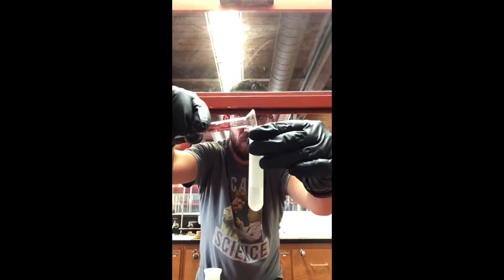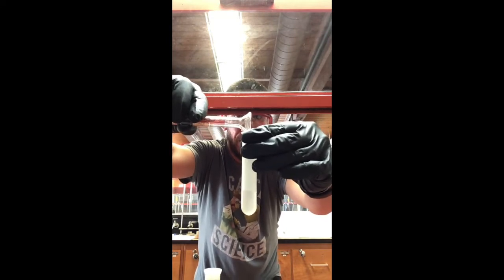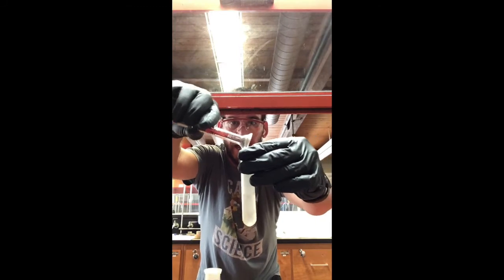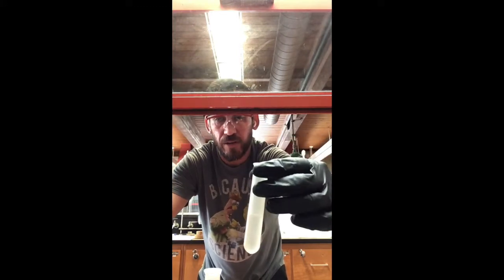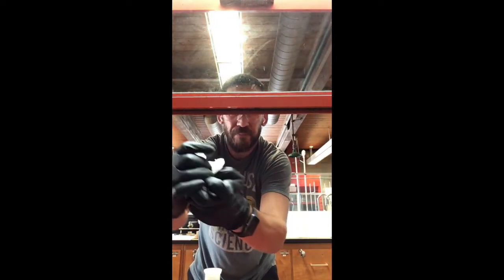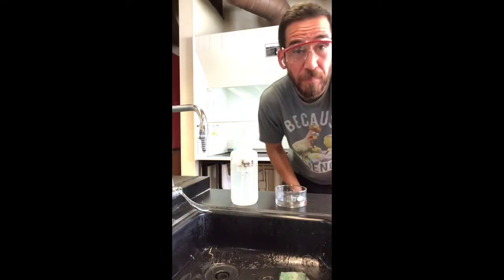Remember, this is the original centrifuge tube with the caffeine supposedly in that water, okay? Now, what we're going to do is cap that, give it some inversions for about a minute, and then let the 2 layers settle, okay?